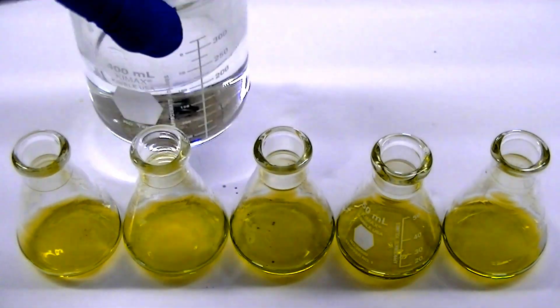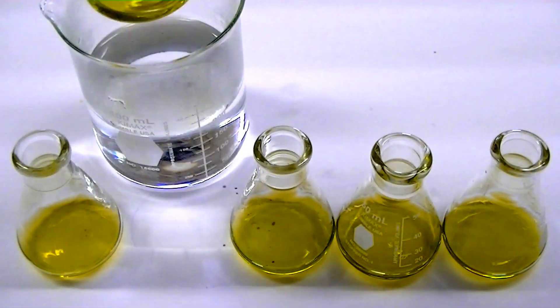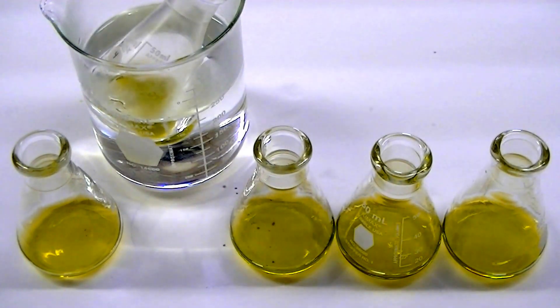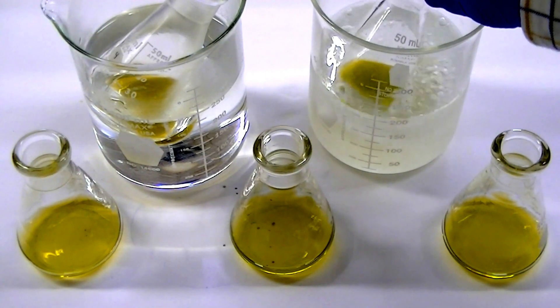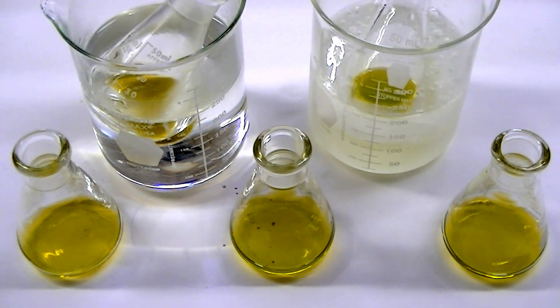Now let's explore how we can use this chemical system to generate a whole host of colors. To create yellow and green, we'll simply warm and cool the yellow-green dichloro-copper complex as I described previously.